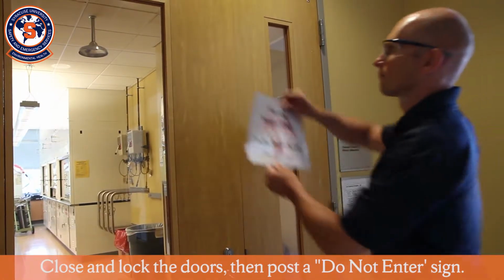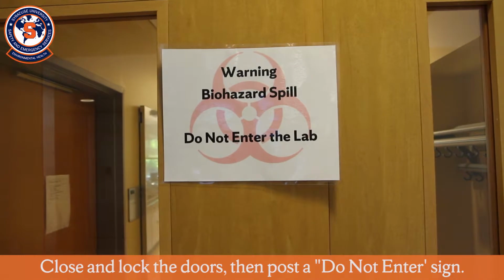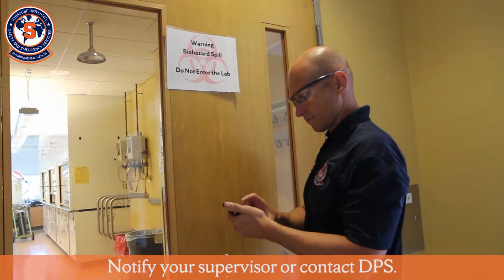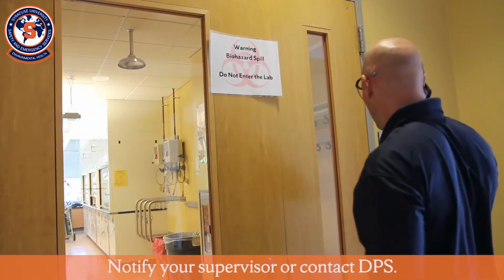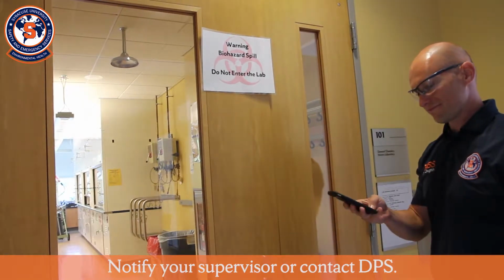After everyone has evacuated the lab, close and lock the door. Post a biohazard warning sign and a do not enter sign to keep people out of the area. Notify your supervisor and contact DPS if an injury was sustained or you need immediate assistance. Allow at least 30 minutes for aerosol to settle before re-entering.